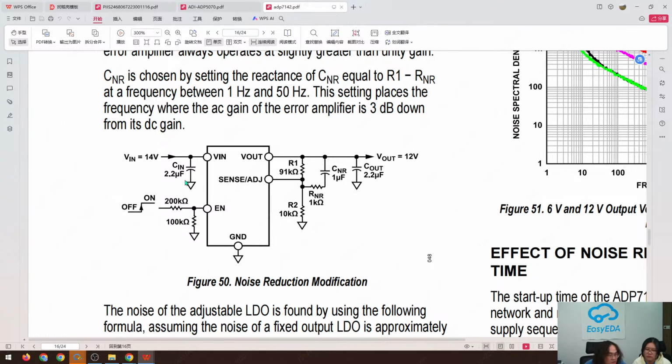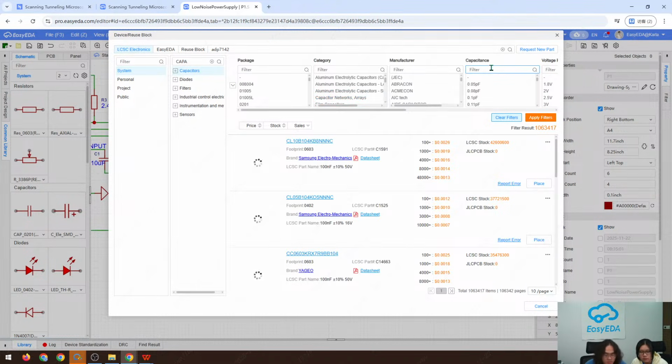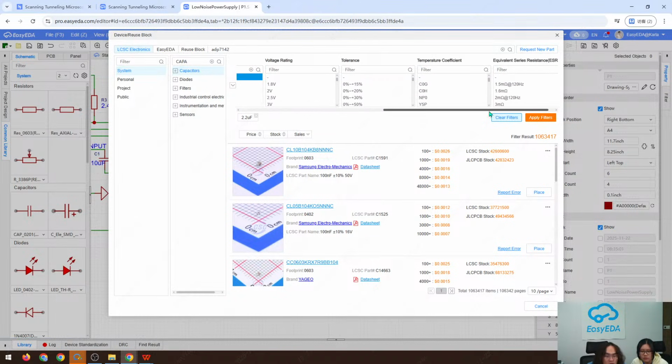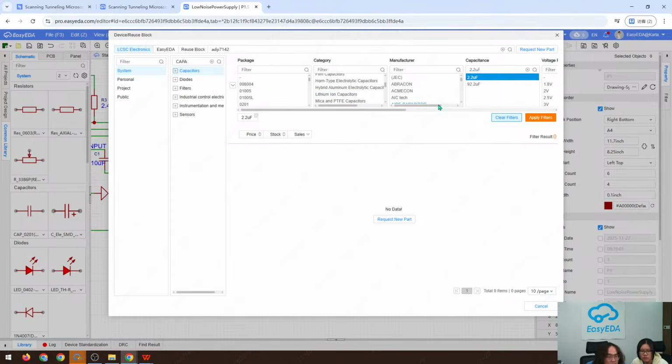Here it's a 2.2 microfarad polarized capacitor. And we can choose the category. Is this type of polarized? So let me double check the capacitor type.